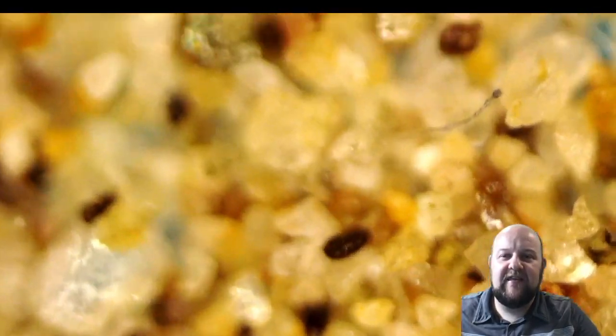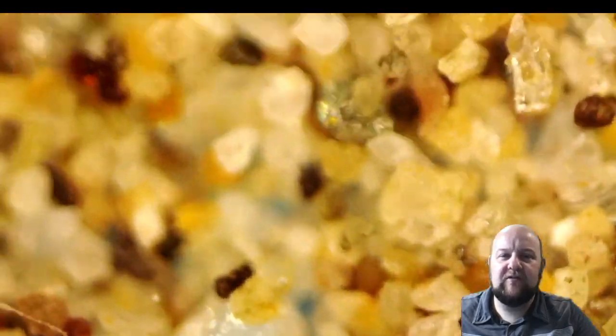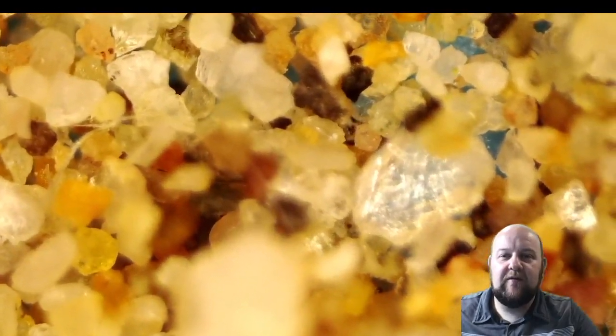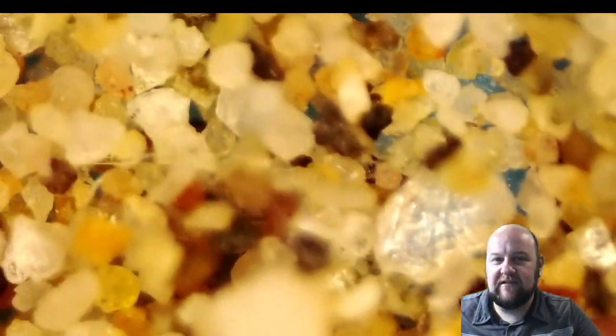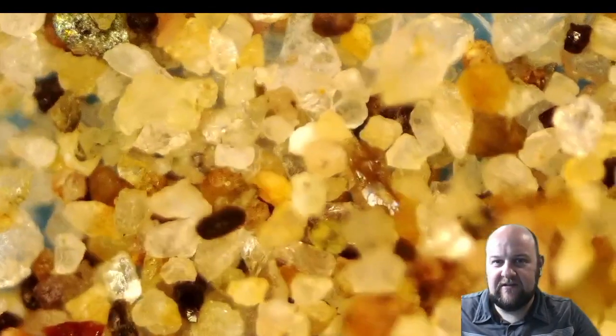And then I thought, well, how about we compare it to the sand in our backyard? We have some playground sand in our backyard. So then I thought, hey, let's go check that out and see. And I wonder if we're going to find what I saw a little earlier. But I found something really interesting. So let's just explore it, and let's go zoom in. Actually, this is 200 times zoom right now.